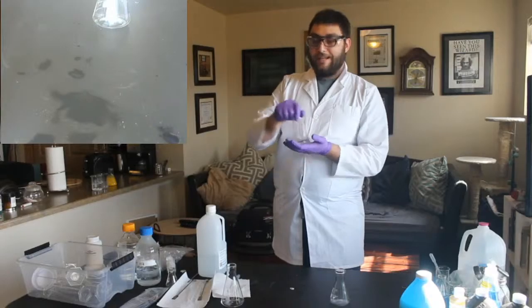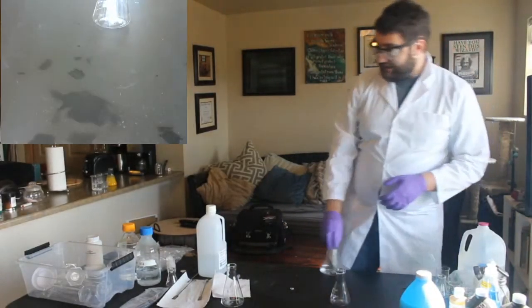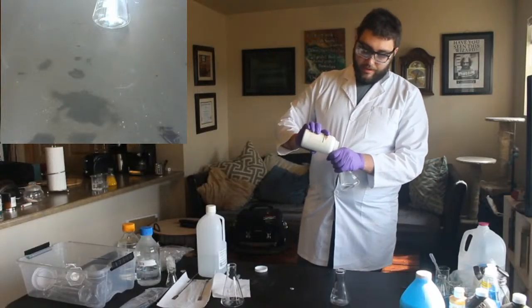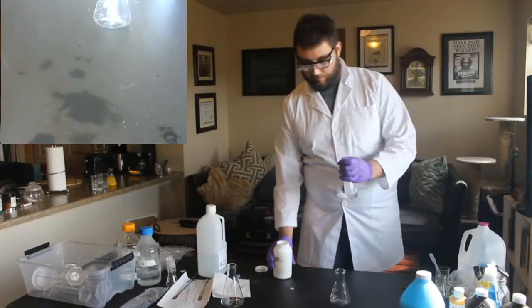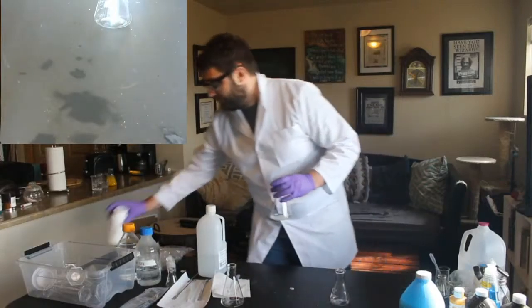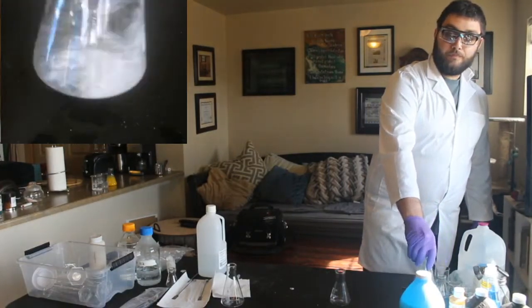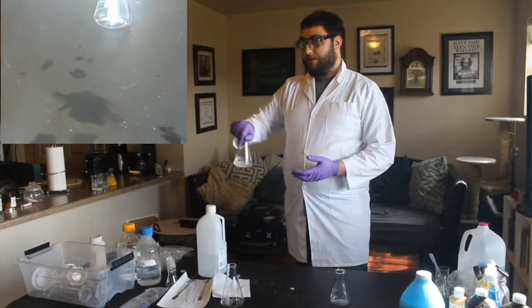So if we heat it up and then cool it down, all of those crystals have now dissolved. So because of that, we're going to add a little bit more, because we want it to not be able to dissolve any more crystals. Again, if you're not making a mess, are you even really doing science? So now we can see there's more crystals in here, and we're going to try to dissolve those. Sometimes it takes a little bit to do that, though.